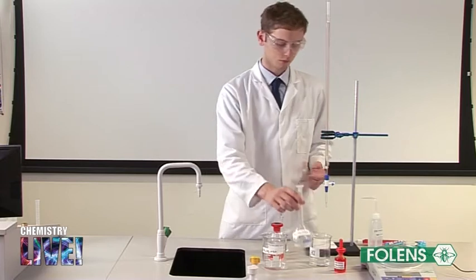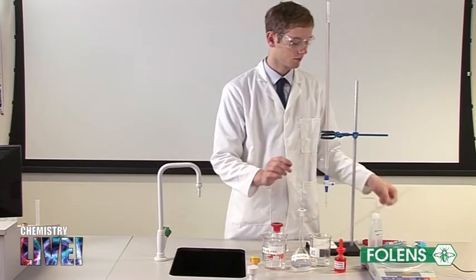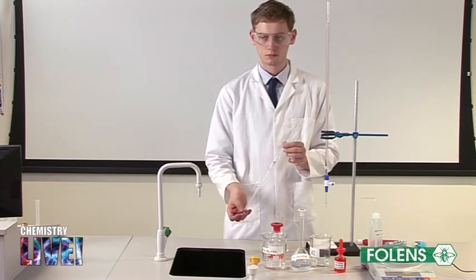The pipette has been rinsed out with some of the sodium carbonate solution and the burette has been rinsed out with some of the hydrochloric acid solution.